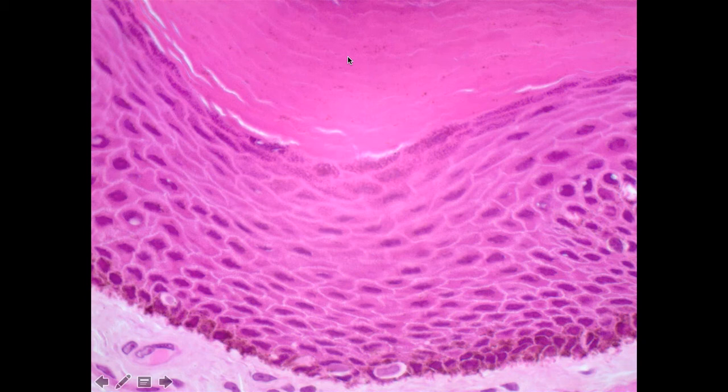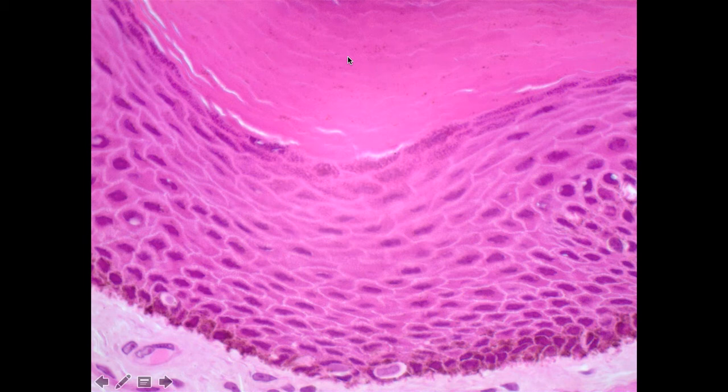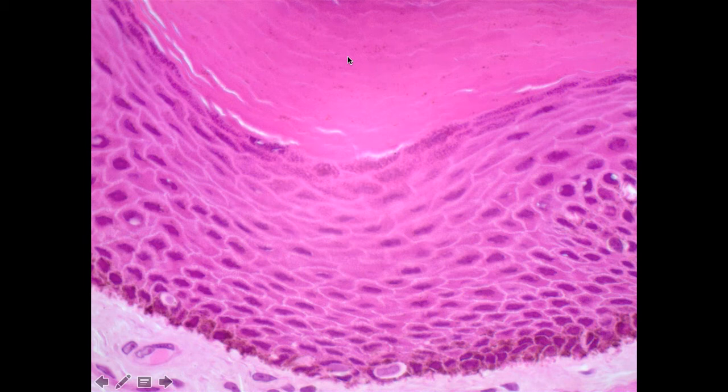In the case of thick skin — there are different types of skin — thick skin is found on the palms of our hands or the soles of our feet. In the case of thick skin, which this is, there should be five layers, four of which are really obvious in this field of view. In thin skin, which would be the skin mostly everywhere else on the body, there are fewer layers, and I'll mention that in a moment.